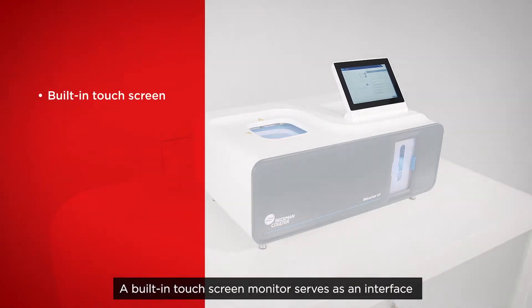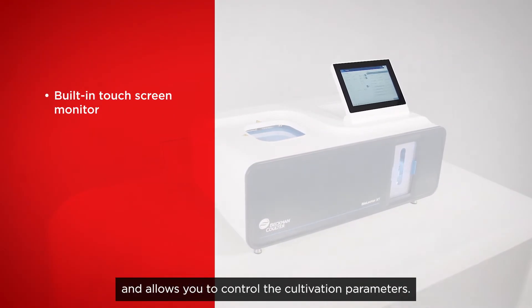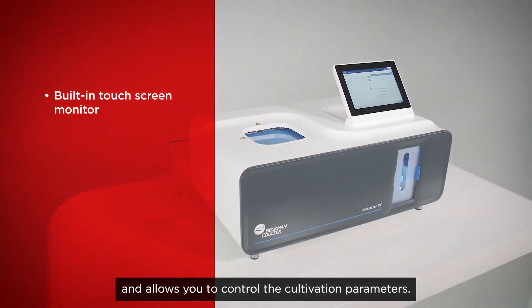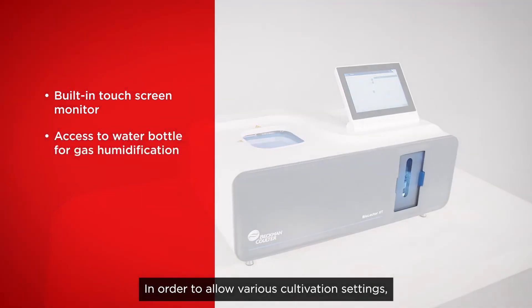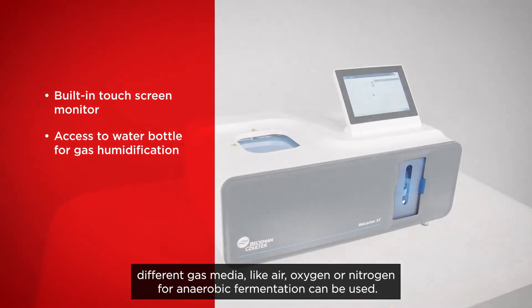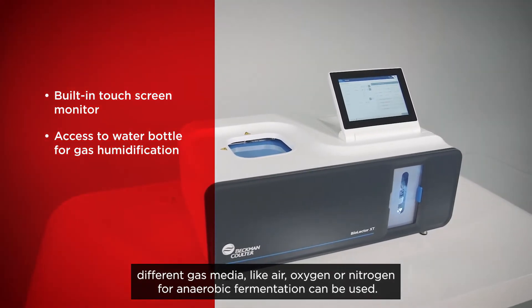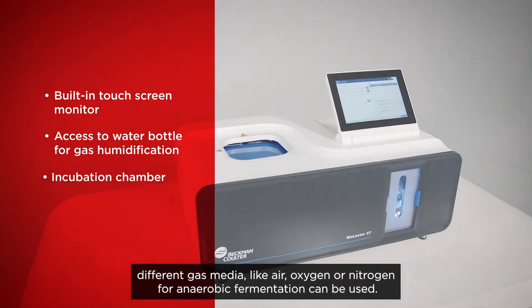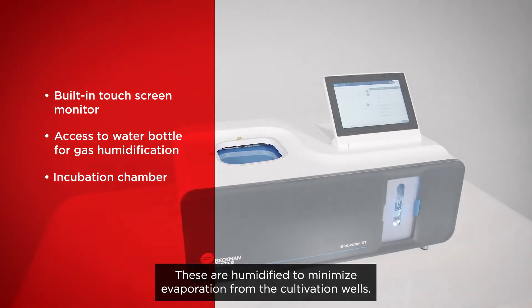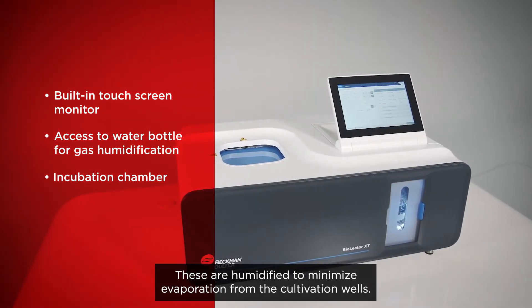A built-in touchscreen monitor serves as an interface and allows you to control the cultivation parameters. In order to allow various cultivation settings, different gas media like air, oxygen, or nitrogen for anaerobic fermentations can be used. These are humidified to minimize evaporation from the cultivation wells.